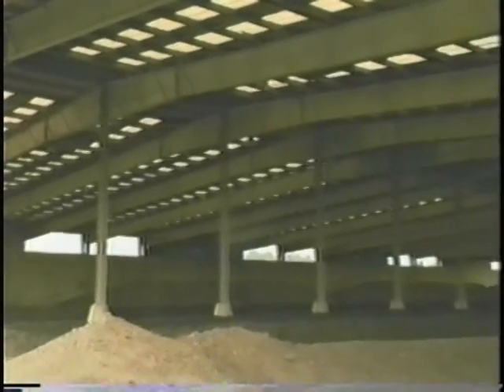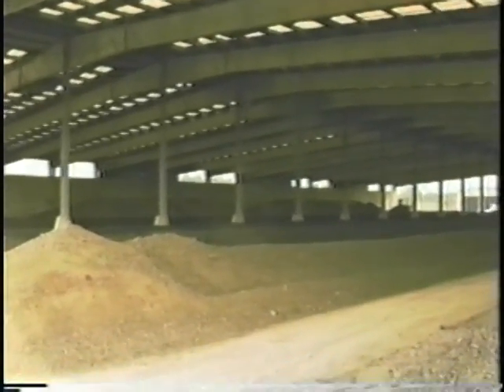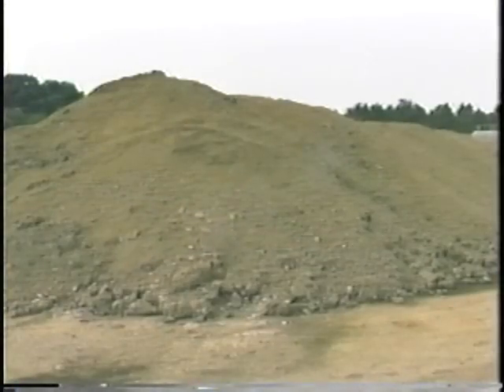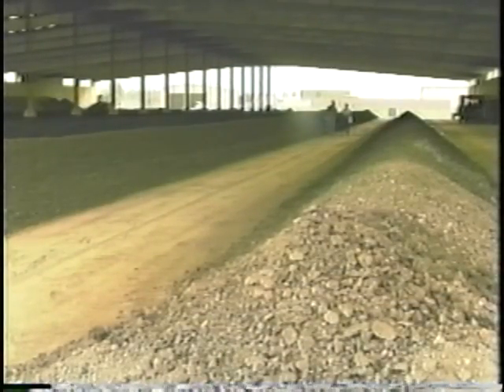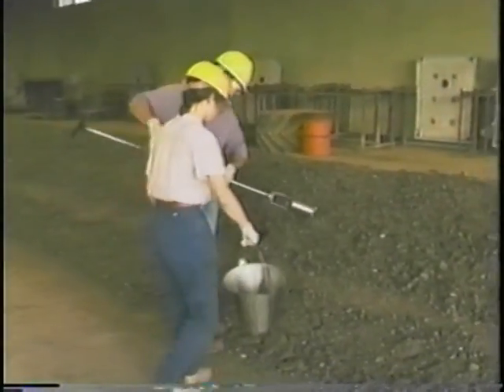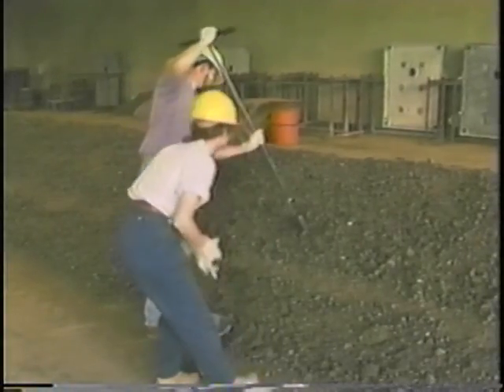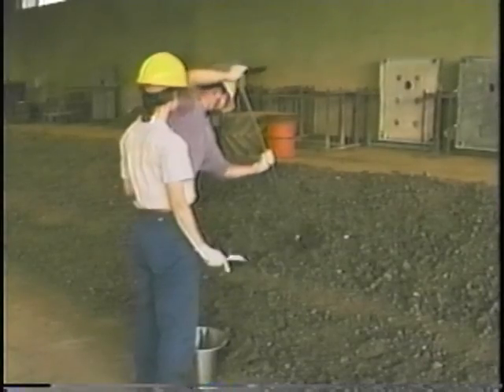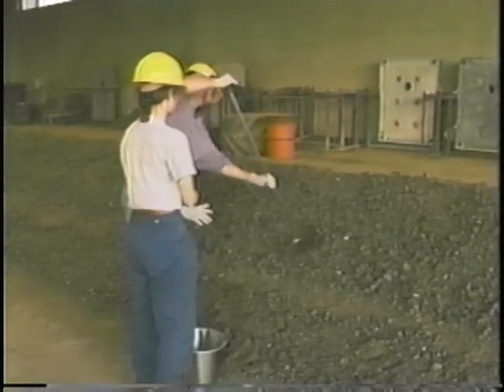Now, we're going to demonstrate sample collection procedures from sludge piles. First, a compost pile, and then a stockpile. Again, because we are collecting samples of the final sludge product before it is land applied, samples must be collected from piles which are fully cured and ready to be hauled off-site. For a composite sample, full cores of sludge should be collected from randomly selected sites distributed along the length of the pile. No less than 4 cores should be collected and mixed together.